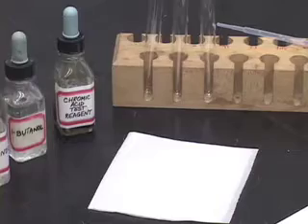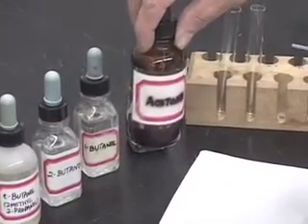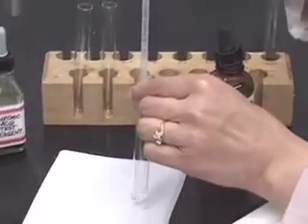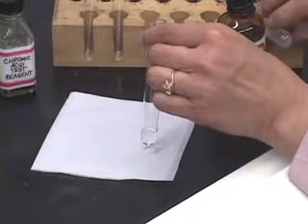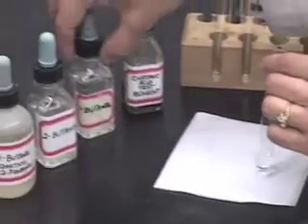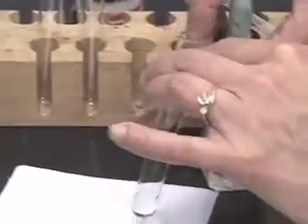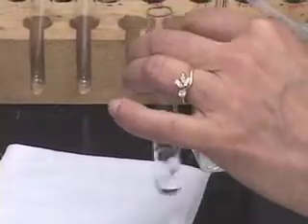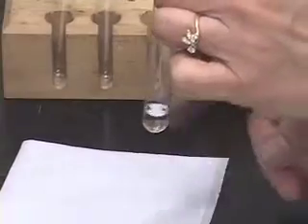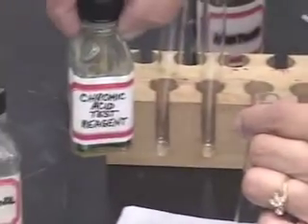Let us see how this test is done and observe the test results. First, you want to take one milliliter of acetone in a test tube. Add a milliliter of acetone, and then to this you want to add two drops of your test compound. I am going to test 1-butanol. Add two drops of the test compound, mix it, and then to this we will add the chromic acid test reagent.